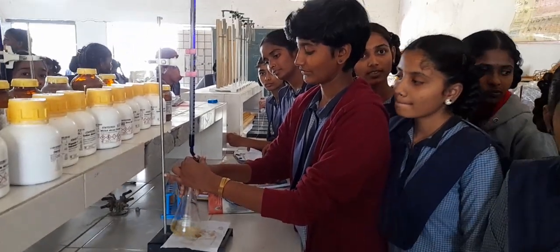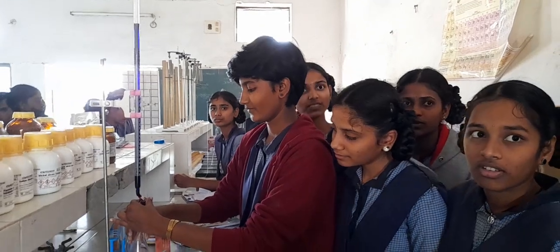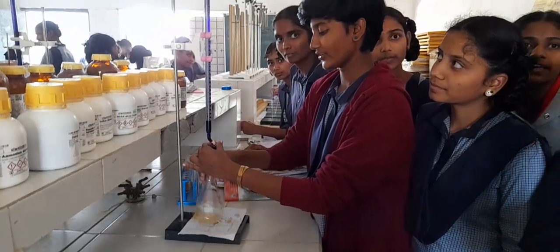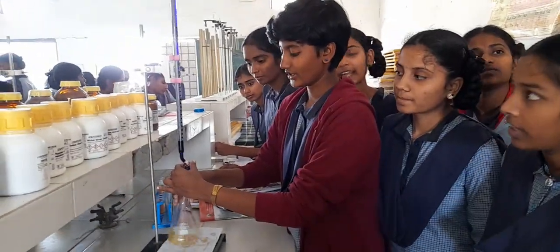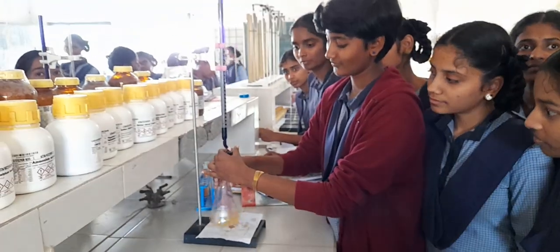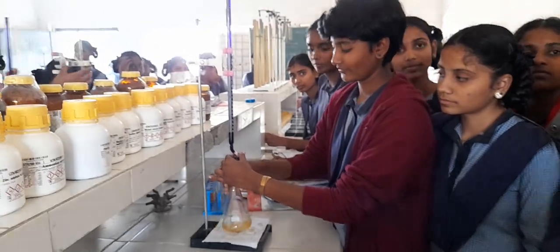Okay. So what could be the end point? Pale pink. Is this your first reading? No, ma'am. Second one. What was your first reading? 19.5. Oh, very good. You are very close to the value. Good. All the best. Do the next 2 consecutive readings, and next we will be moving on to our calculation part.